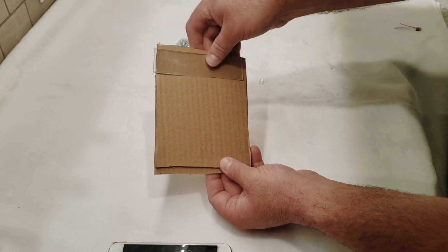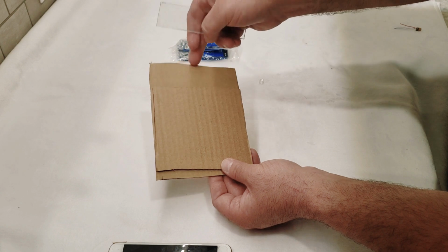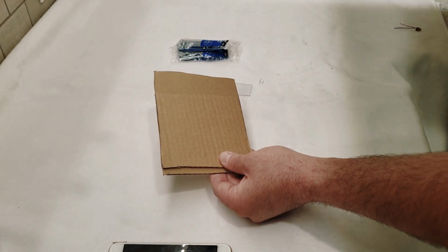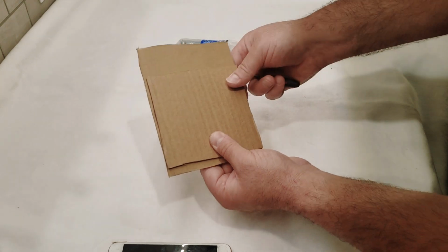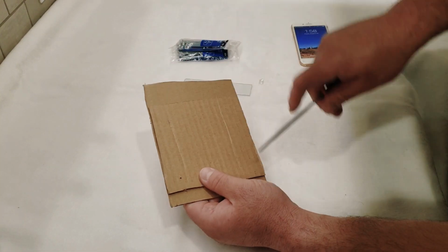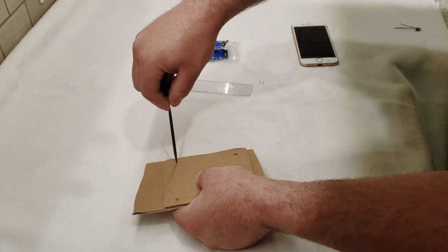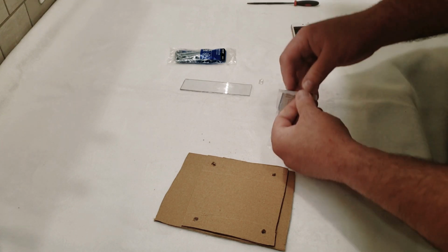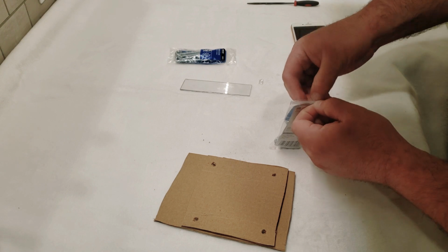That is because we are going to have four bolts holding this piece up from the larger bottom piece of cardboard, and then two bolts holding this last piece. So I'm going to line these two up and just take, I just got this file. It's a square file, but anything really that pokes holes will do. We're just going to line it up and poke our four holes. I'm just going to take these four bolts, and these come in little four packs at Walmart, and they're about, I think, just 97 cents.